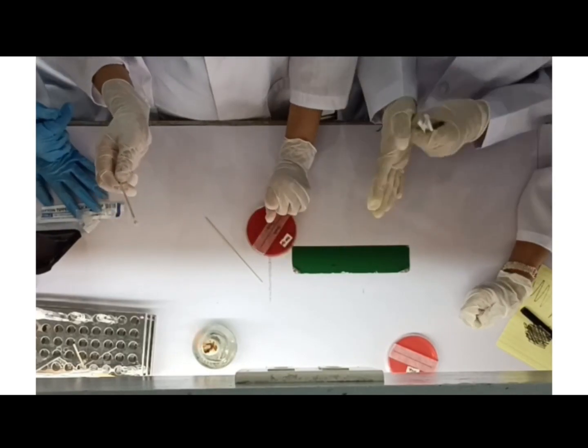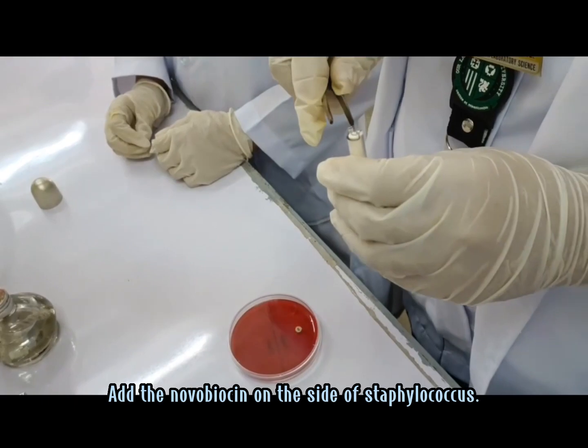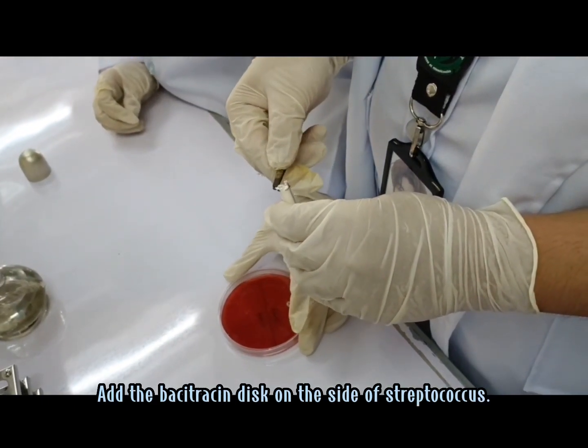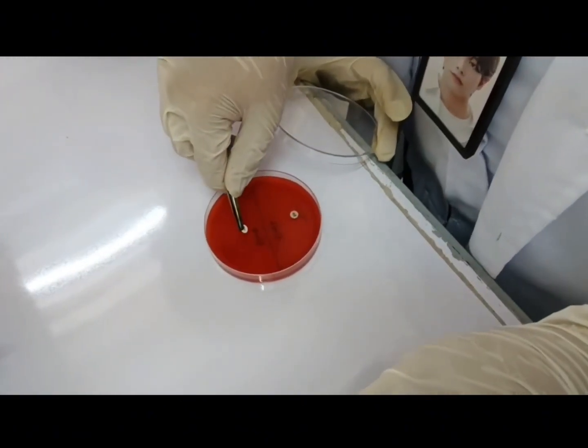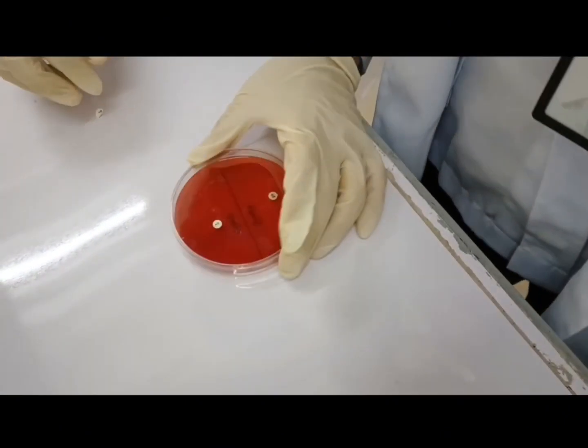After that, we will need to wait for another 15 seconds to let it dry and then add the antibiotics. After the addition of antibiotics on each side, we will incubate it and wait for the result.